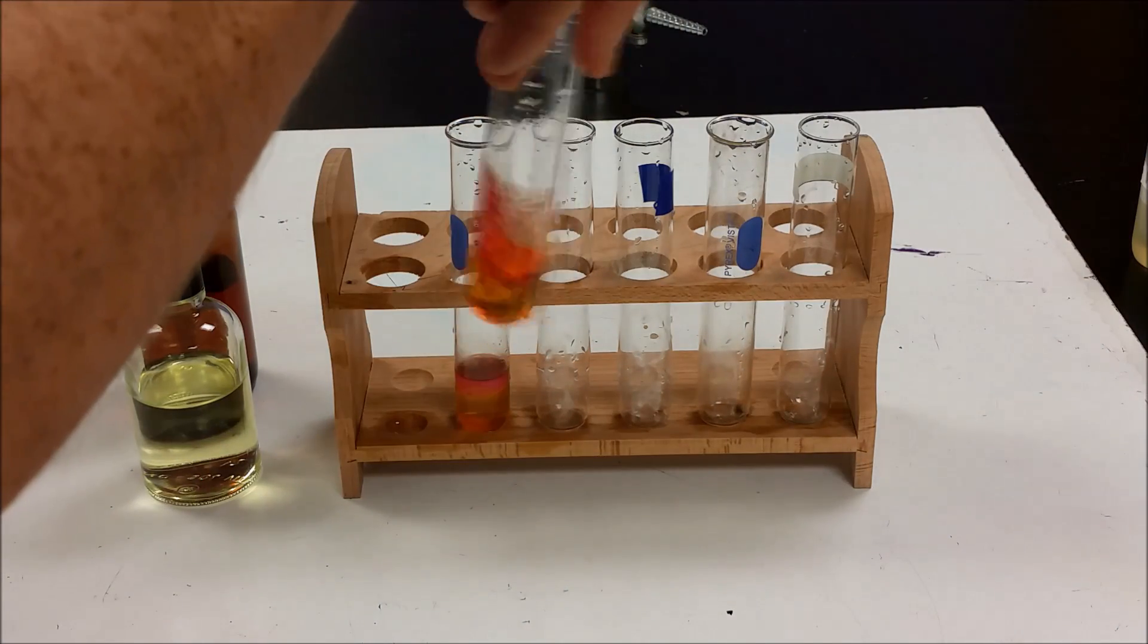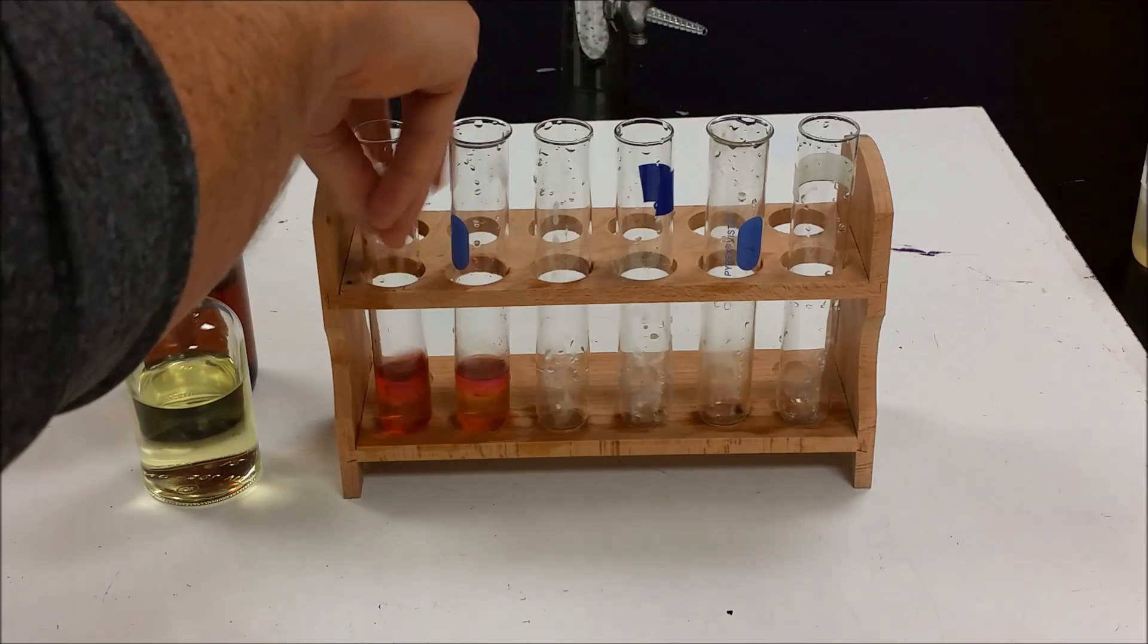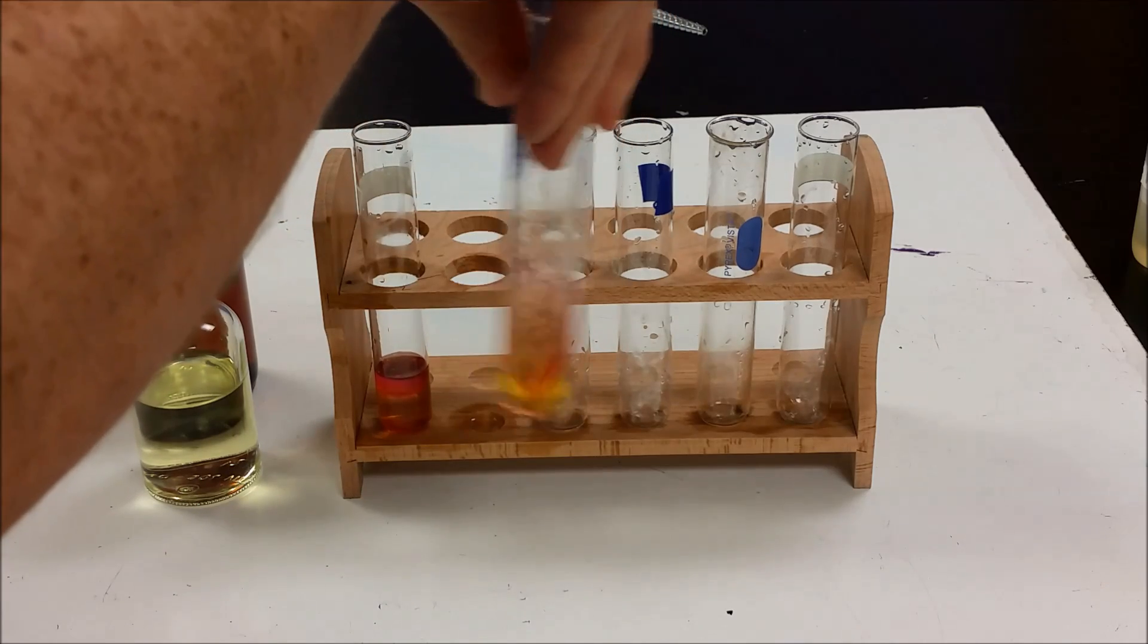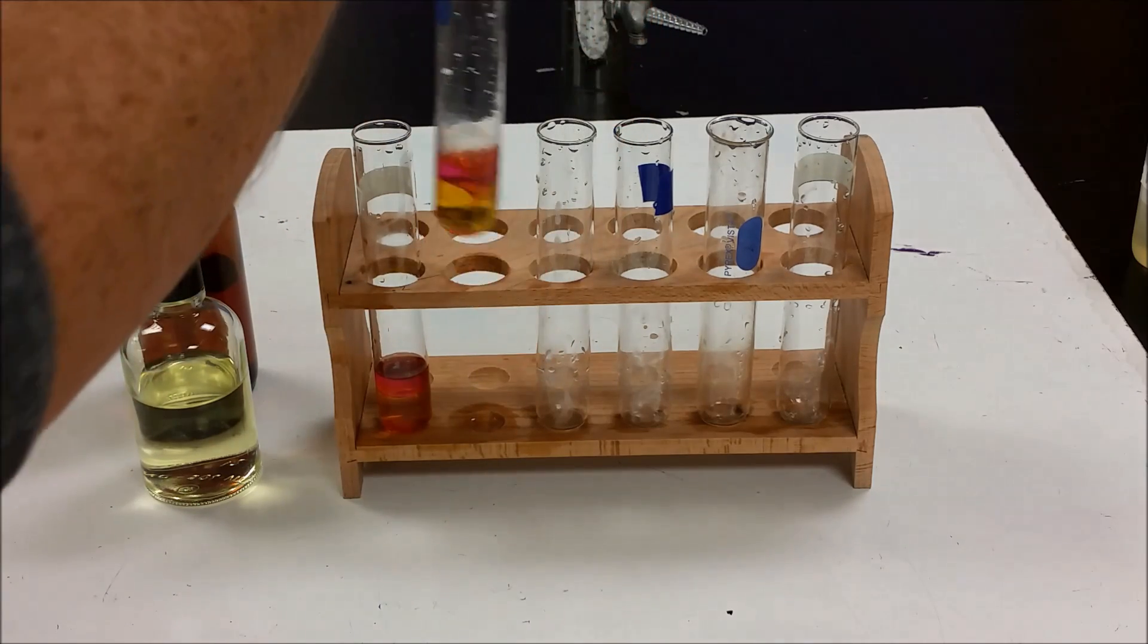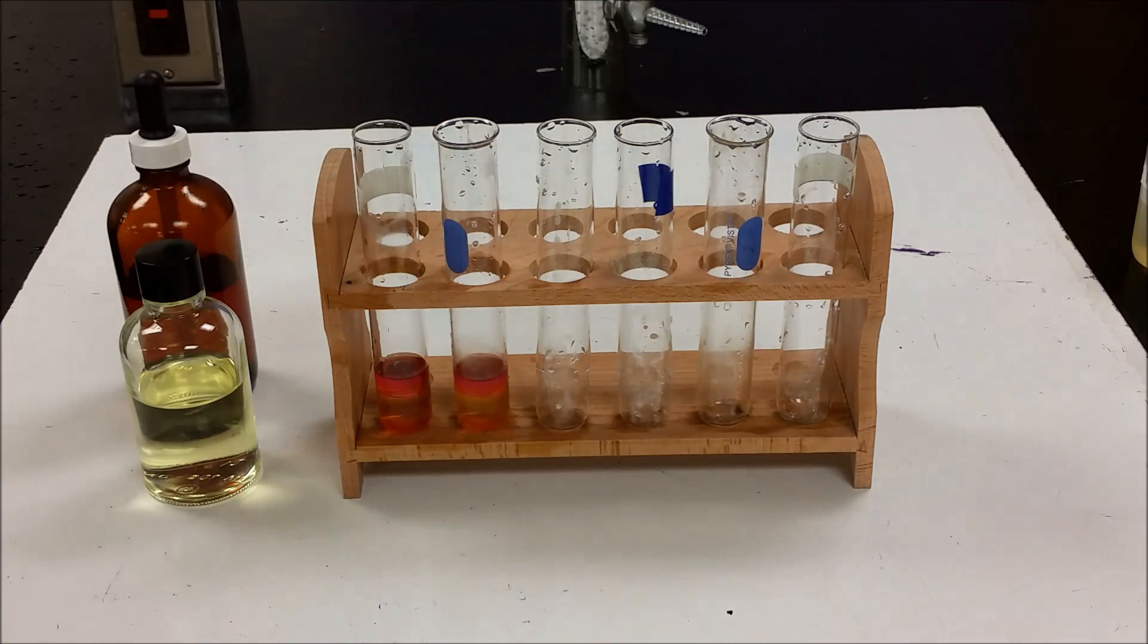Swirl it around, swirl it around, and we can see that that purple color is still persisting, which means that the iodine did not react with anything.